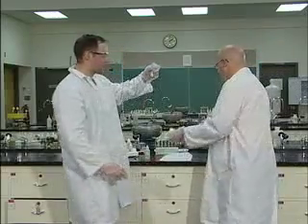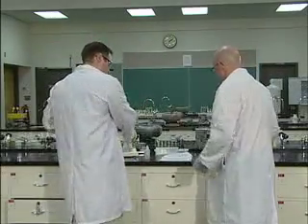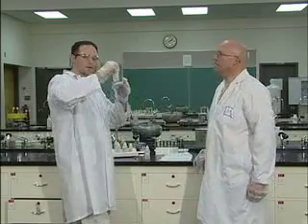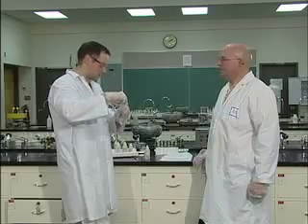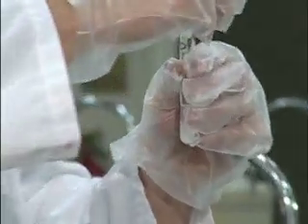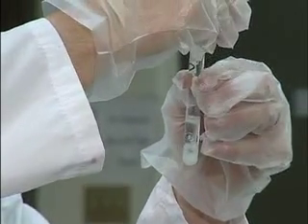Now to this, after we've added the barium nitrate, using the same tube, you don't change tubes, you're going to add nitric acid. Nitric acid is one of the nastiest substances in the world. It's not very user-friendly. Please be very careful with it. HNO3, you'll notice that they're brand new bottles. This is because each semester they eat through the bottles each time. So just be careful with it. And to it, we're going to add 15 drops of nitric acid. Ooh, that one just comes out like a squirt.